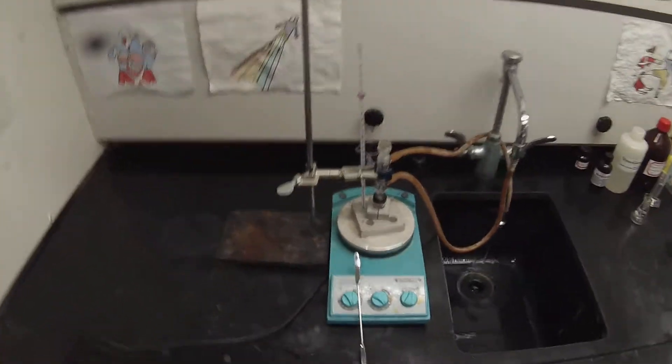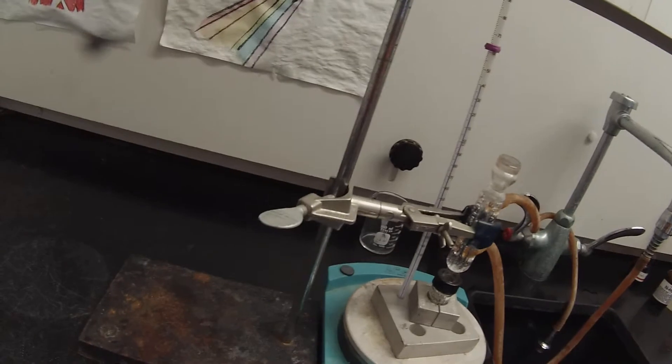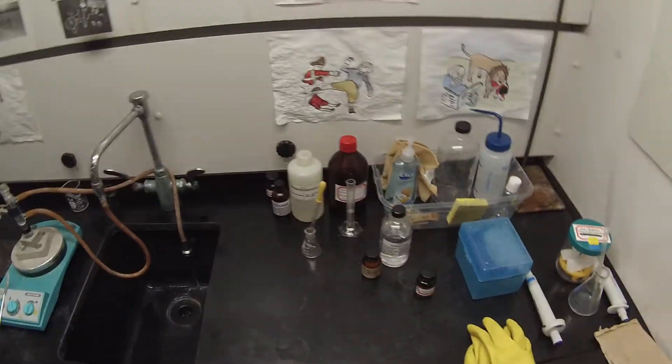So while our n-butanol reaction is refluxing away at a nice constant temperature of 140, we're going to set up the reaction with the t-butanol.